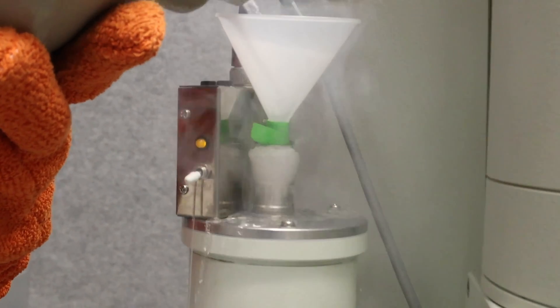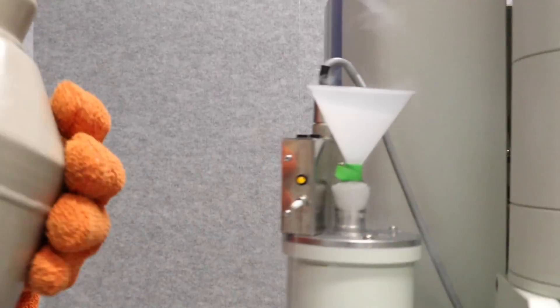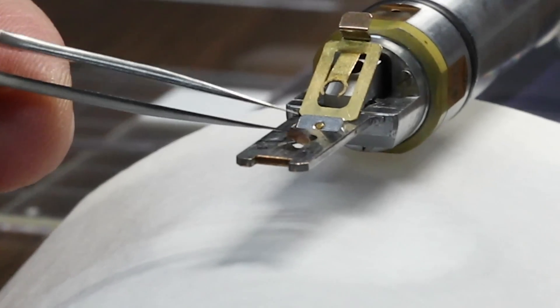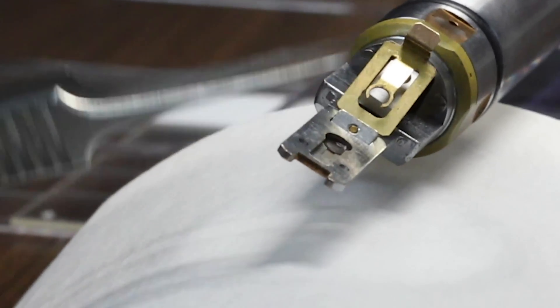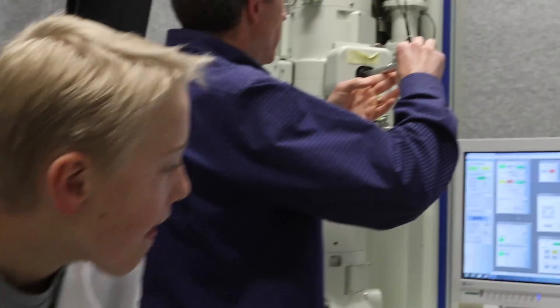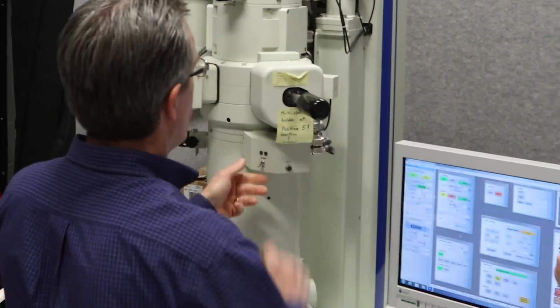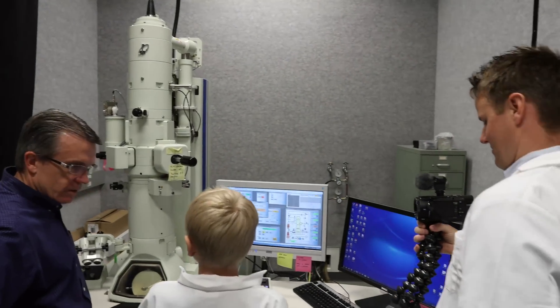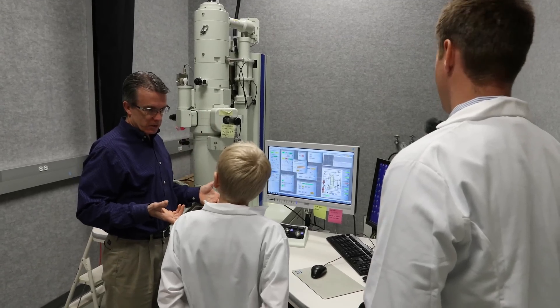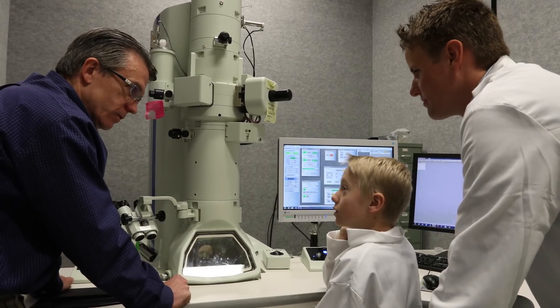This is very, very, very, very cold. Now we need to clamp it down. All right, the sample is going in, everybody. The sample is in. So this is like an airlock, just like the astronauts when they go into space. So you want to drive, Lincoln? And I'll tell you how to drive.